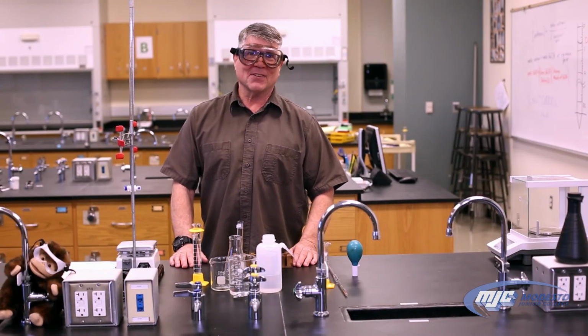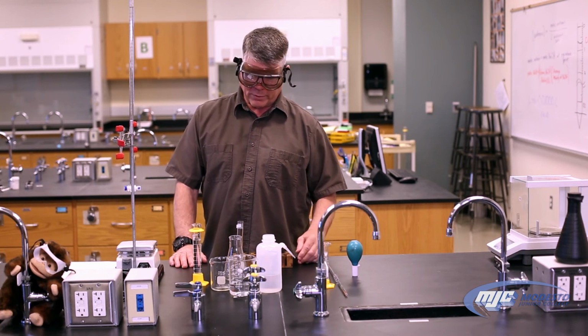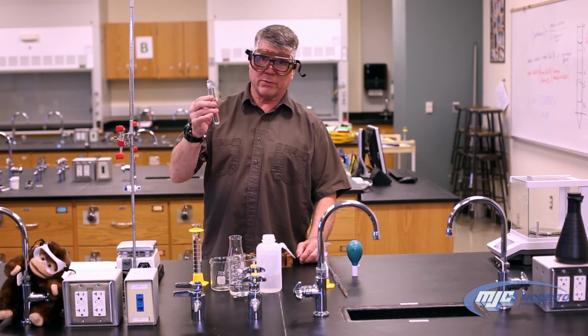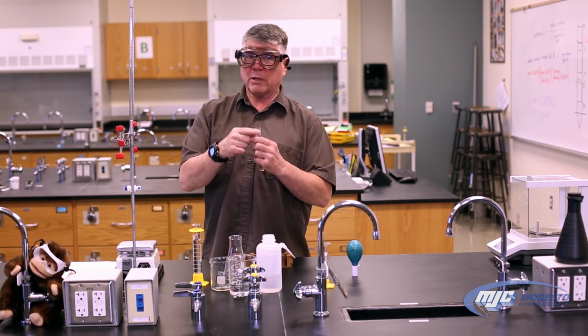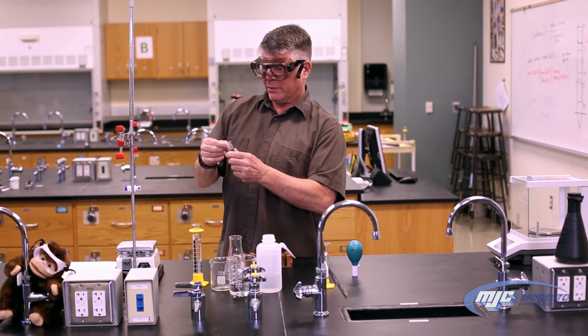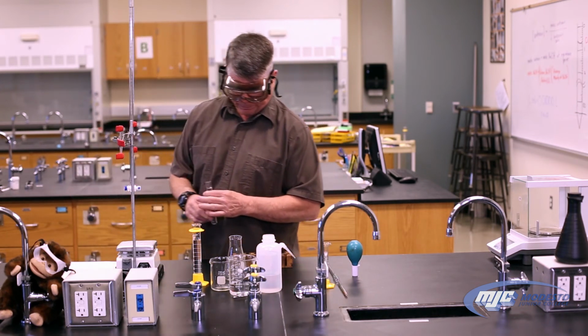All right, guys, so this is the second part of the acid-base titrations lab, and what we're doing in this part is we're going to determine the concentration of an unknown acid. It looks just like this. So the first thing we do is, as always, unknowns come with unknown numbers, so if you're actually doing this, take the unknown number off and stick it in your data table where it asks for the unknown number.